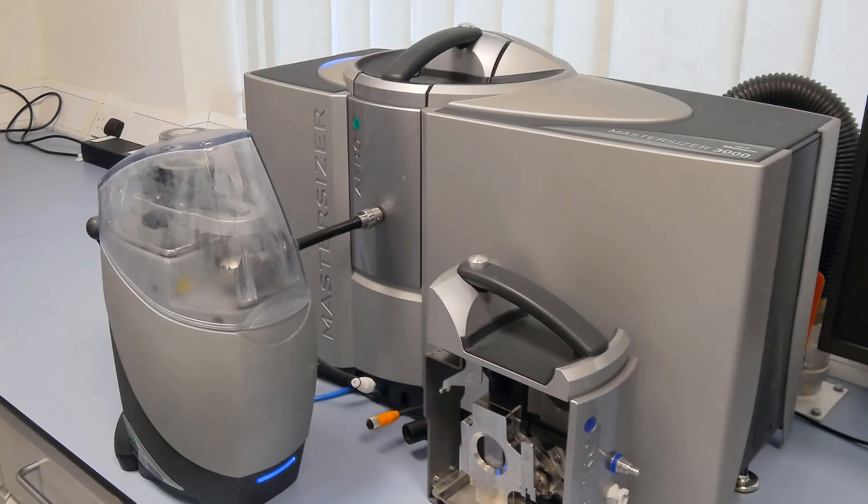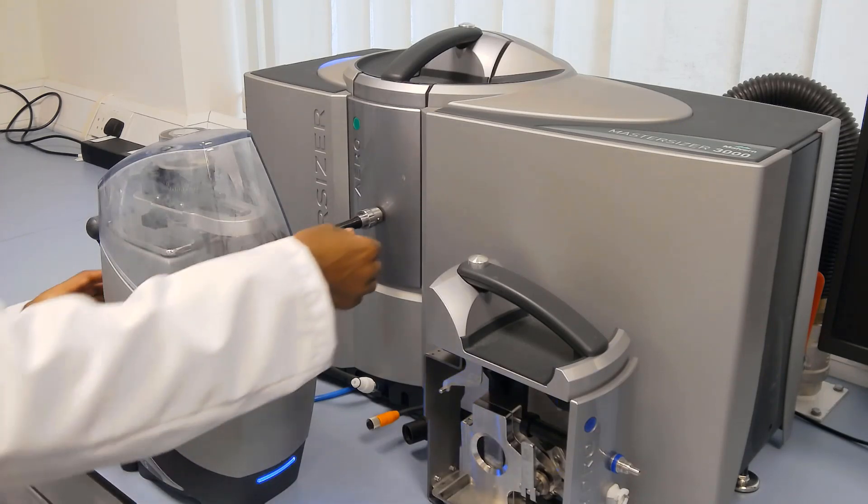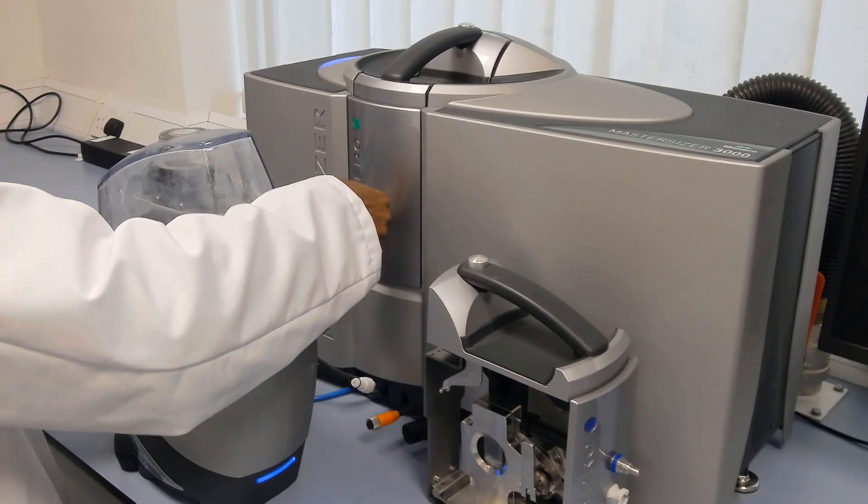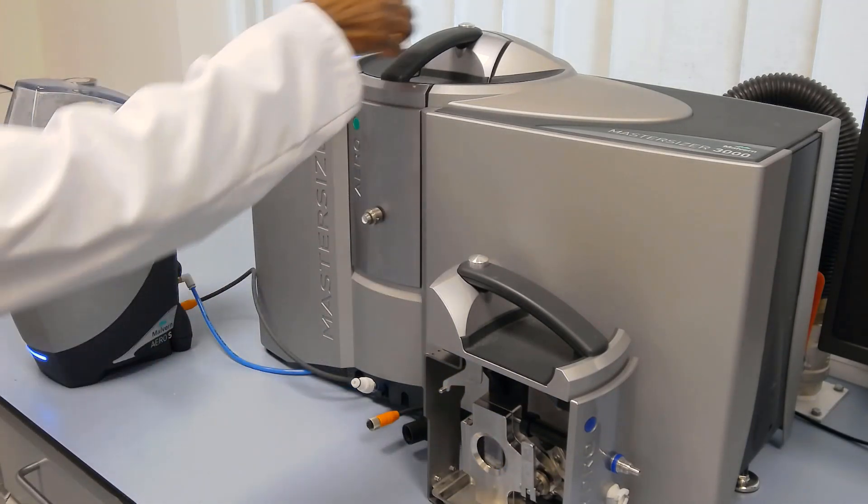If a metal powder is less suited to dry measurements, a common reason being the need to keep sample usage to a minimum and possibly retain it, then wet measurements can be done instead just as easily.